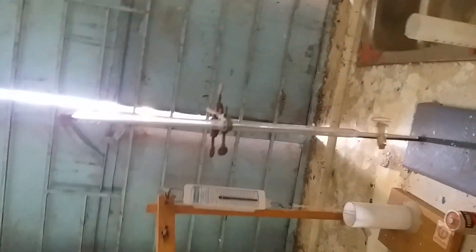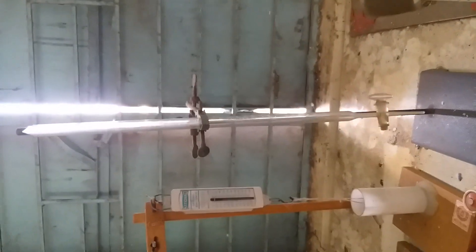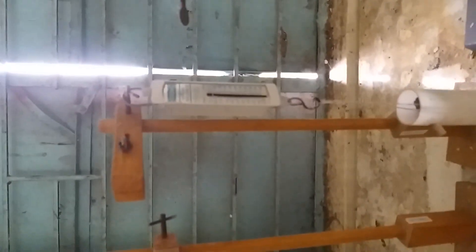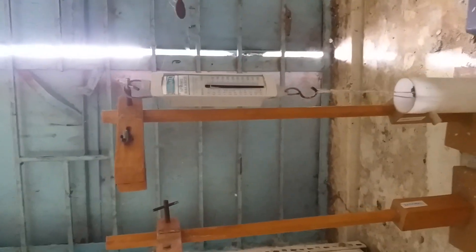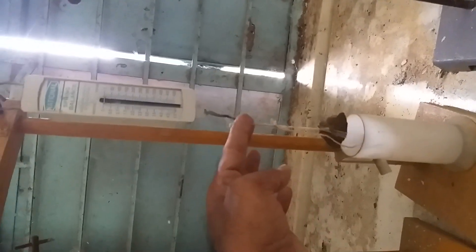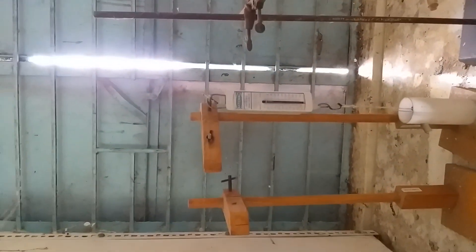This is an electric fuse, this is the bulb. Here is the burette — see, this is a burette. And this is a spring balance used for Archimedes' principle.